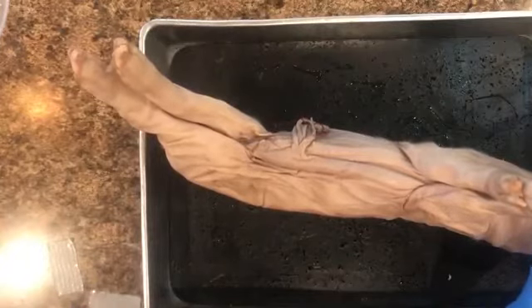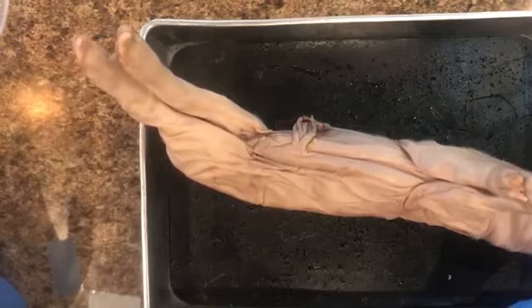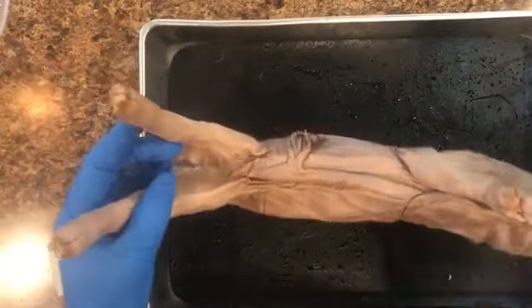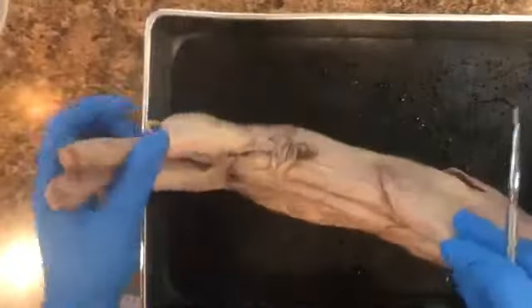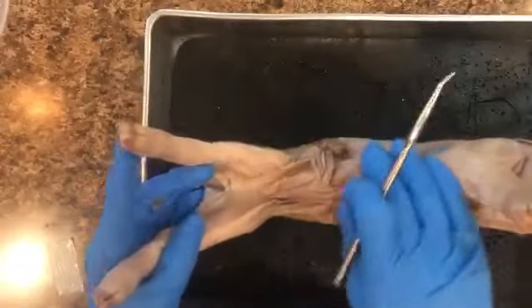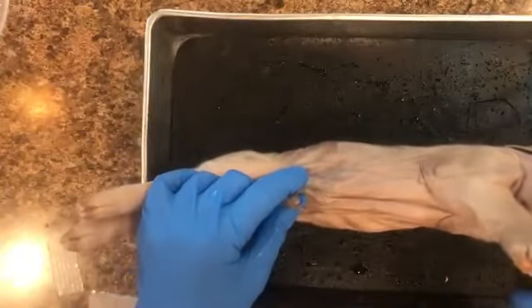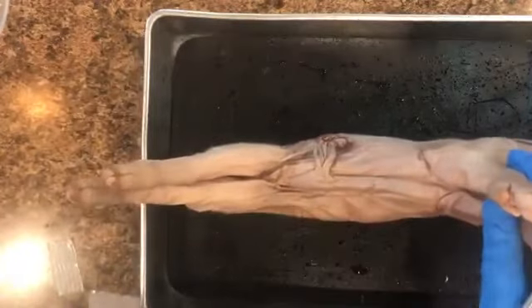Okay, there is the anus, which would be the butt, and also mammary papillae, which are present in males and females. So looking at the tail end here, the anus, and then all of them, whether they are male or female, are going to have these mammary papillae right here, or the teats. Just like males have nipples, females also have nipples. All right, so what's the sex?